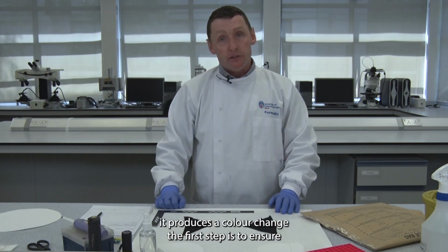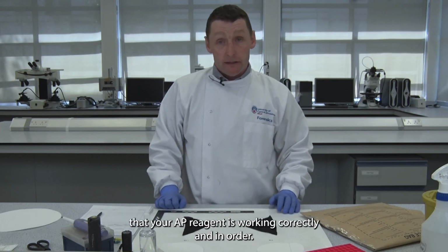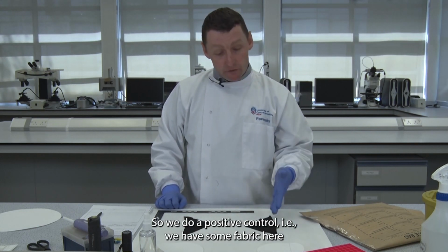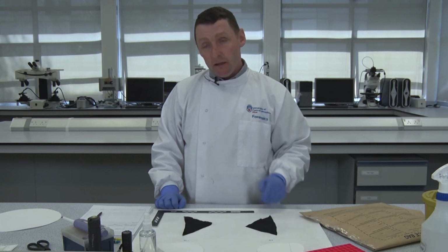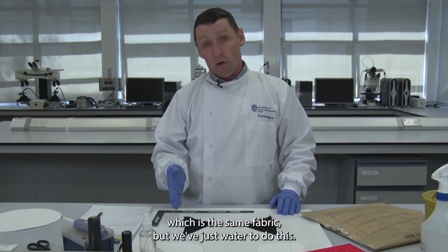The first step is to ensure that your AP reagent is working correctly and in order. So we do a positive control, i.e. we have some fabric here with a known seminal fluid deposited on it, and we have a negative control, which is the same fabric but with just water.